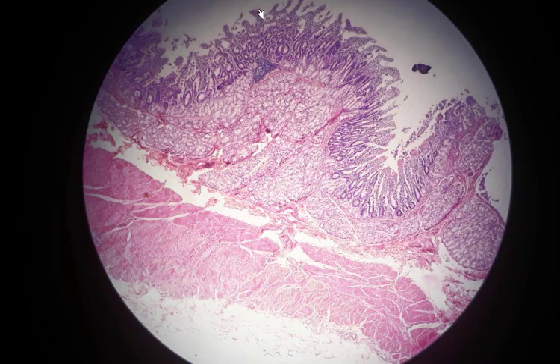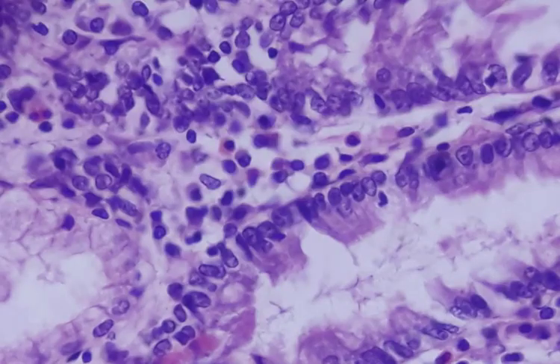And finally, some intestinal epithelial cells contain closely packed microvilli or striated border at their apical surfaces that we can sometimes see on the free surface of the absorptive cells in well-preserved intestinal villi under the high power. Here you can see some absorptive cells with thin brush borders on the apical surface of them.